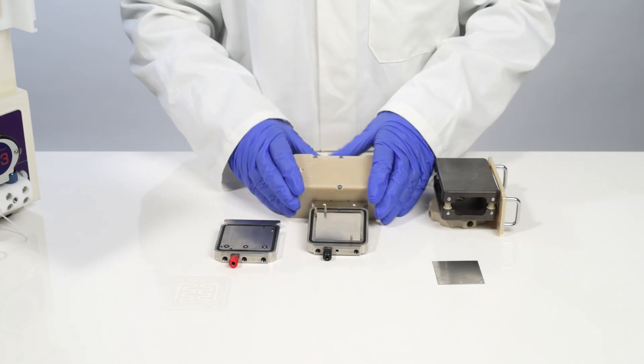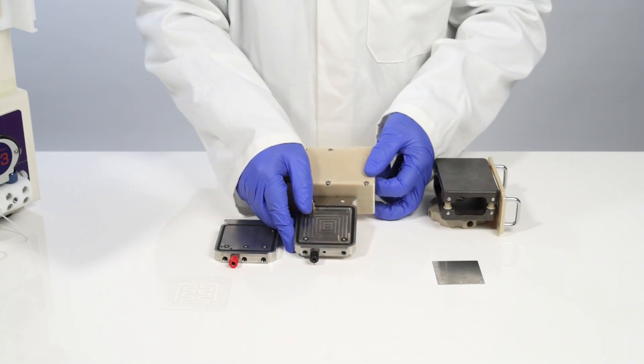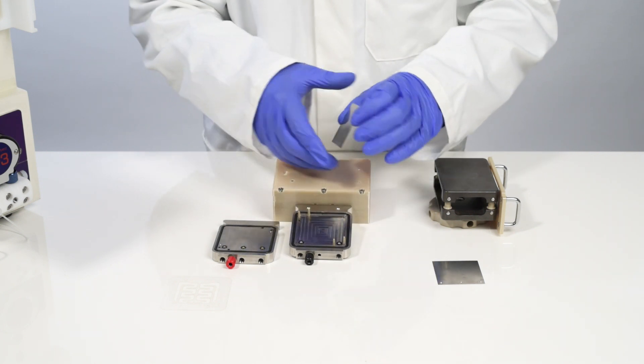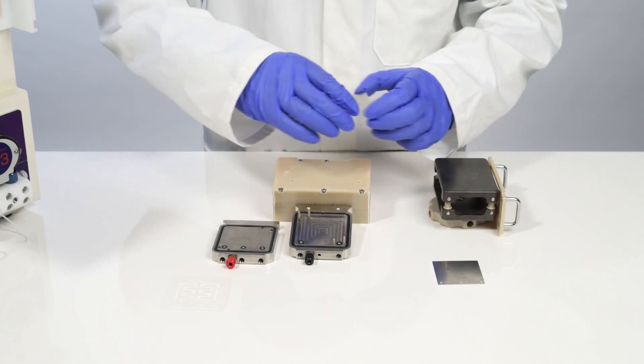Finally I'm going to replace the bottom electrode. Again this can be any material that is commercially available in the 5cm x 5cm area.